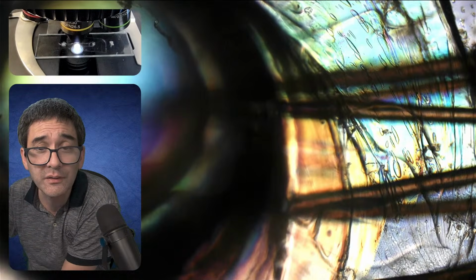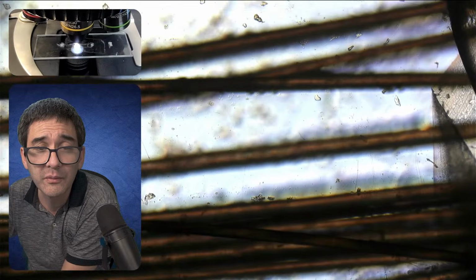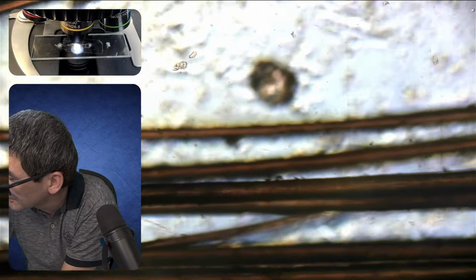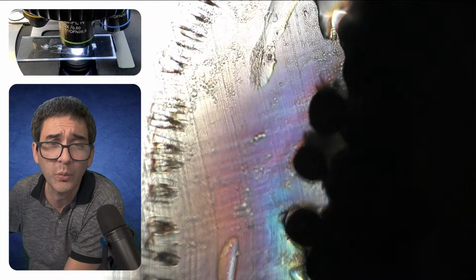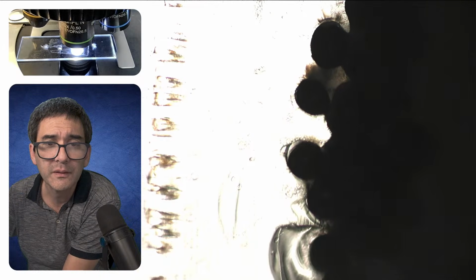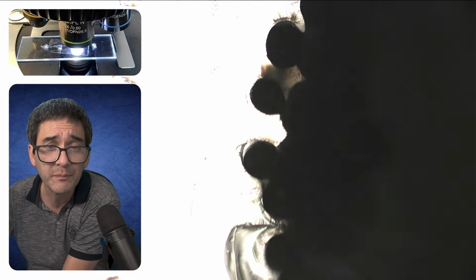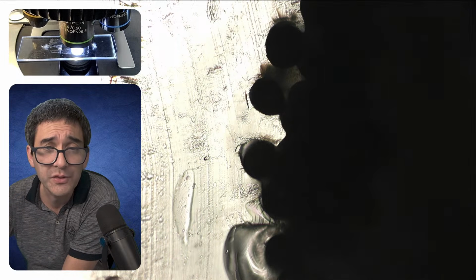Where is this? Nope, that's the other. I have to find it. Just a second. So I'm just going to show you why it did not work the way I hoped it would, because the hair is too dark. Sometimes failed experiments are also quite useful.